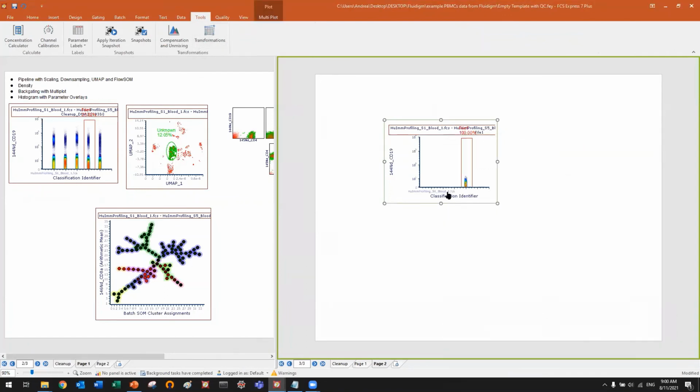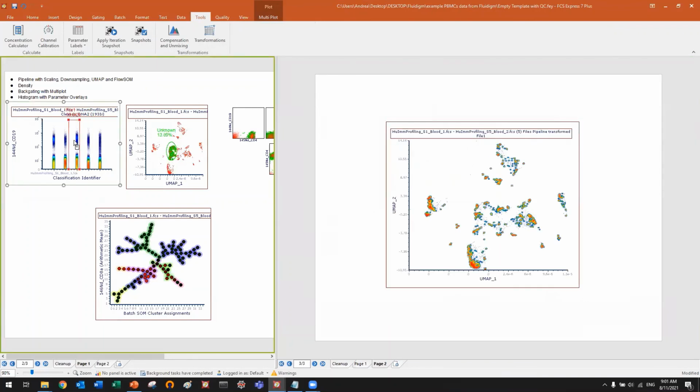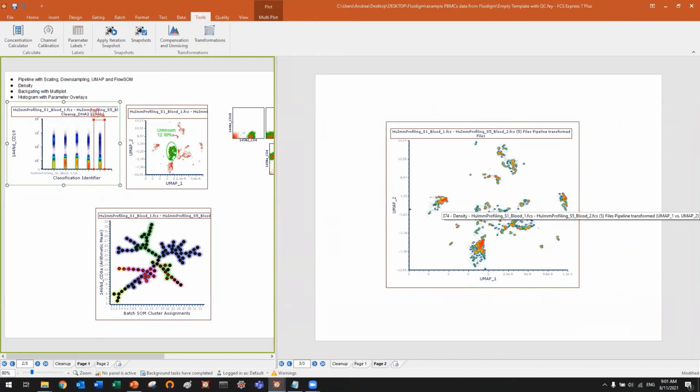Okay, so here I want UMAP 1 and UMAP 2. Okay, this is page 2. You can see if I move the gates on page 1, the plots on page 2 are updating live. Doesn't matter how many pages, how many plots, they are all connected together. You don't need to do anything, it's done automatically.